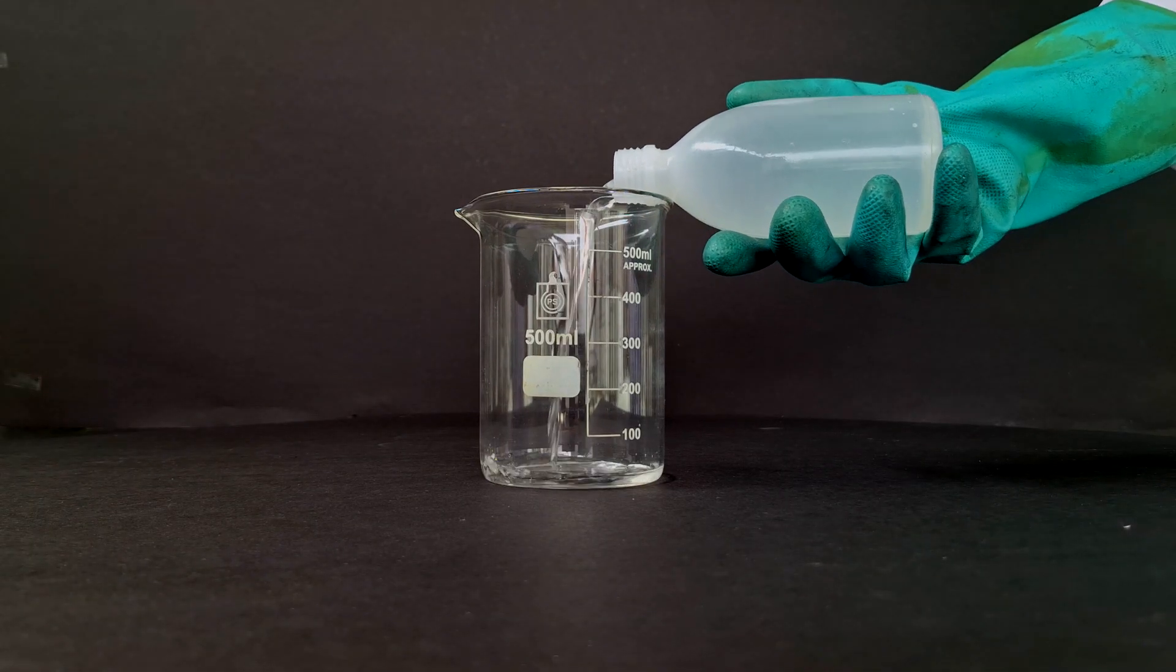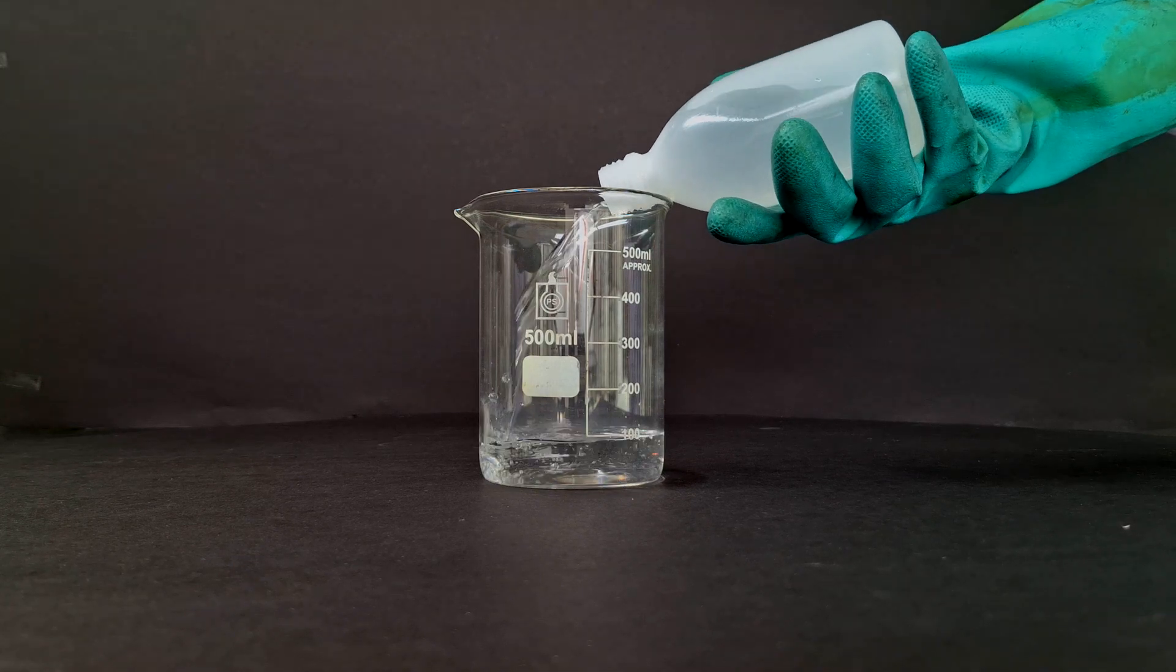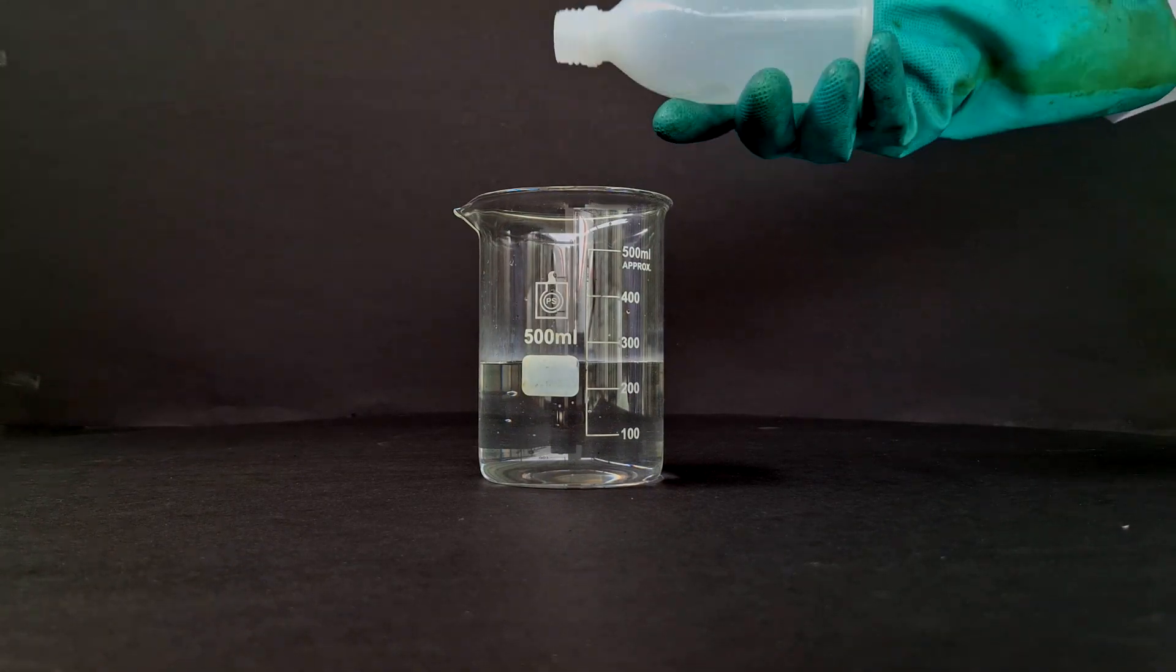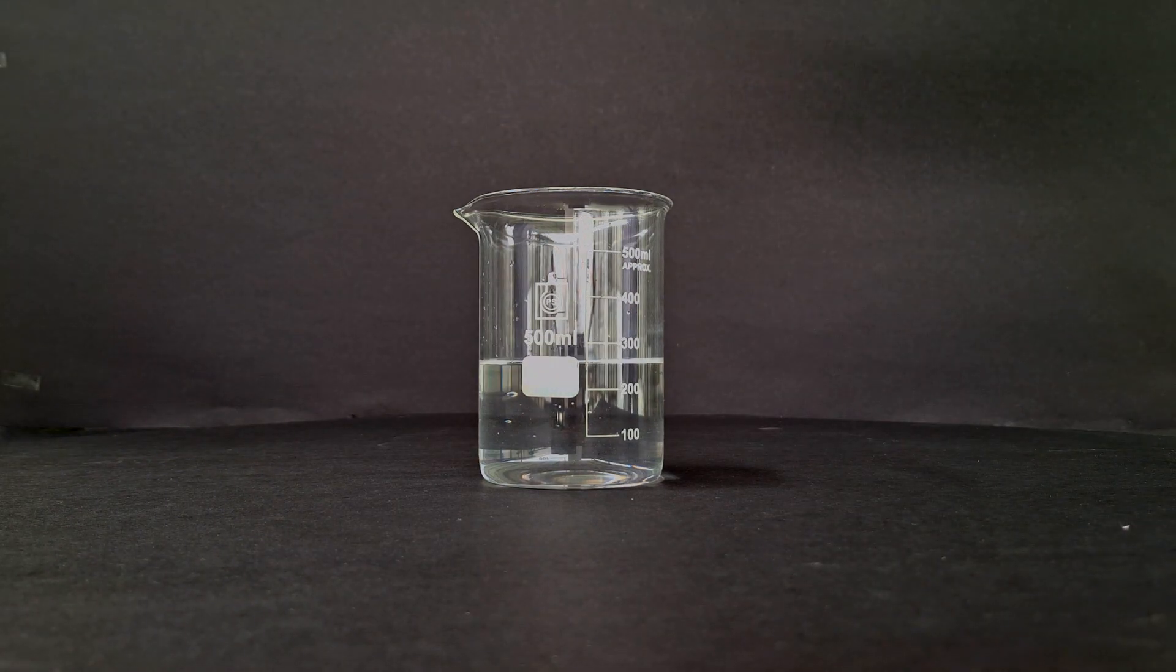I decided to use a 500ml glass beaker as the bottom container, and proceeded to add distilled water into it, although water from the tap should work as fine.